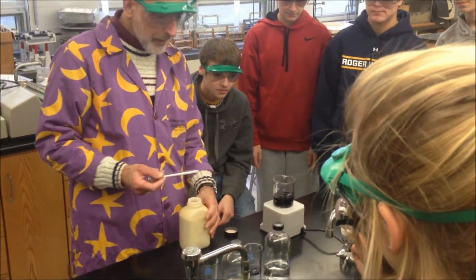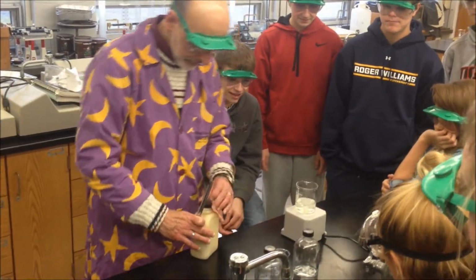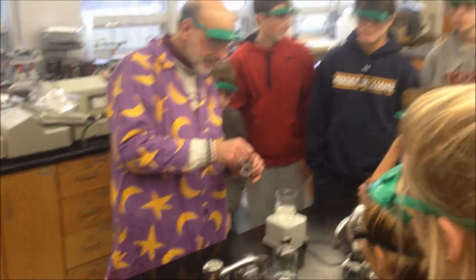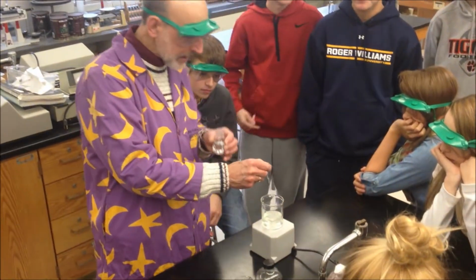Okay, so now I'm adding some of this. Whoa! No way. Well, that was science. How does that happen? These are very sensitive solutions, so sometimes it takes a lot of material. And now I'm going to add some of the potassium iodate.